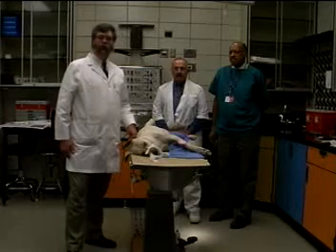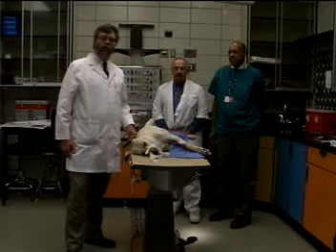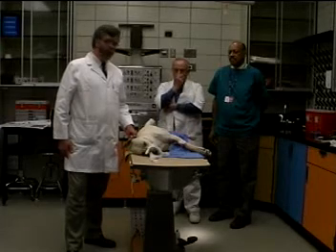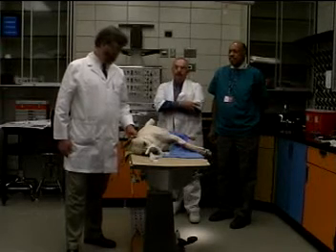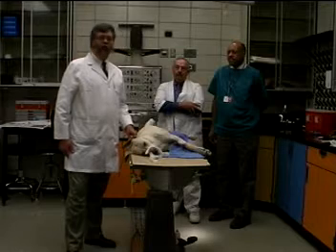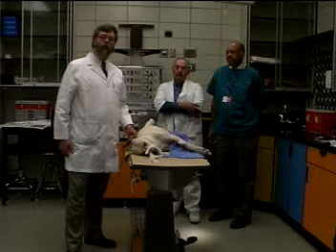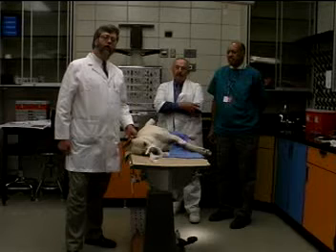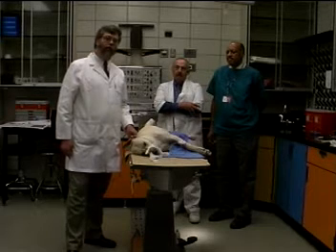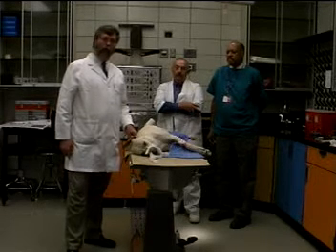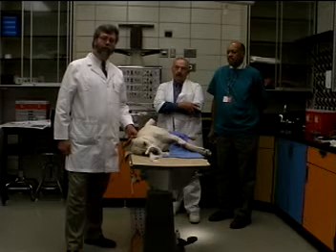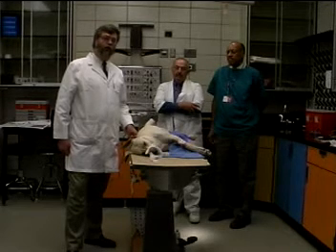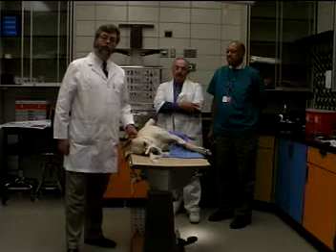We will give a sequence of drugs and describe the effects as they go along and explain the mechanisms behind those drug effects. In general we'll start out giving agonist drugs, cholinergic muscarinic agonists and adrenergic agonists, and then one by one we'll give blocking drugs, blocking muscarinic receptor, alpha receptor and beta receptor to show how each blocking drug changes the responses to our agonists.